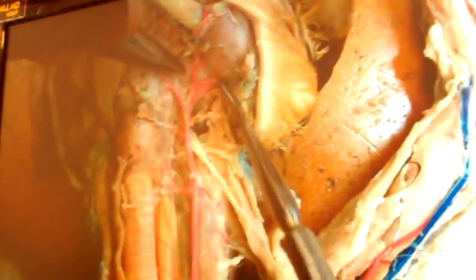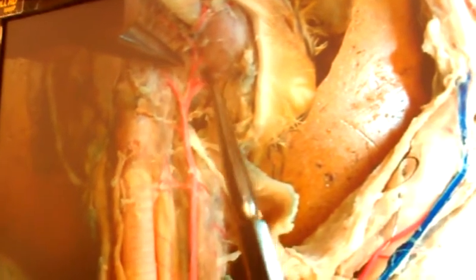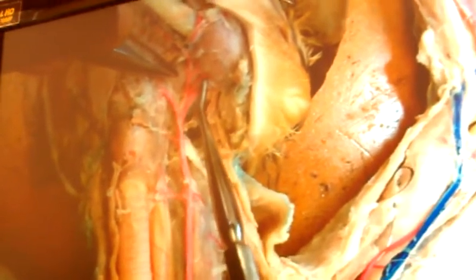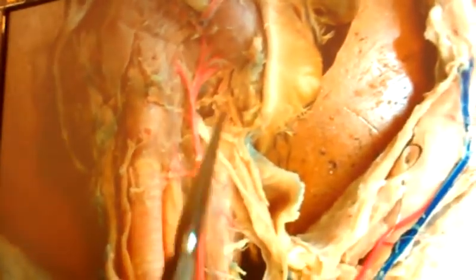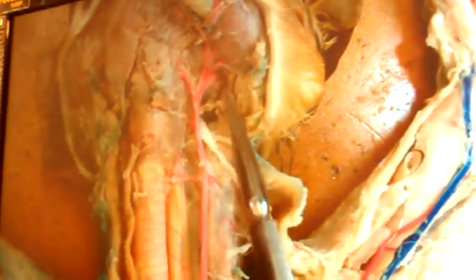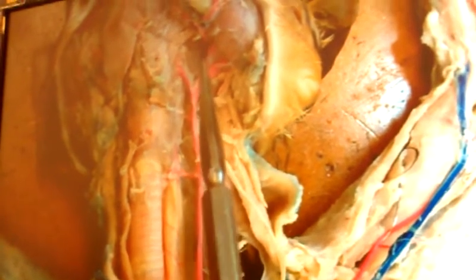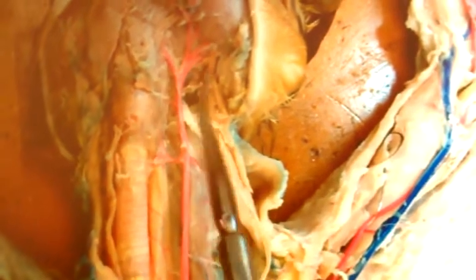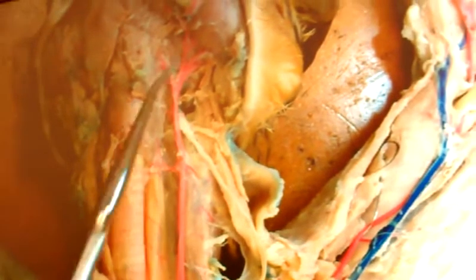But Mr. Gilmore, there's something funny about this. There's some kind of branch coming off the external maxillary, and he wants to go back over the internal maxillary, to go to this gland over here. What's his name? His name is parotid. So, Mr. Gilmore, the rule of thumb is, I notice I got one going in, his name is internal maxillary. I got one going out, his name is external maxillary. And then I notice there's a structure that comes off the external maxillary that wants to give innervation to the parotid gland. We call him parotid artery. All right, Mr. Gilmore, I got that.